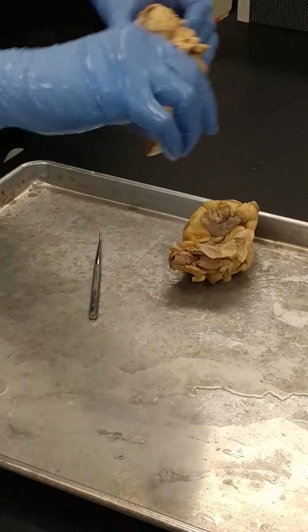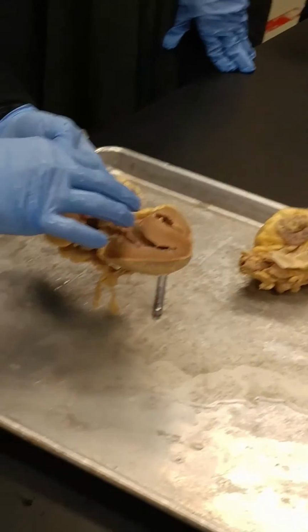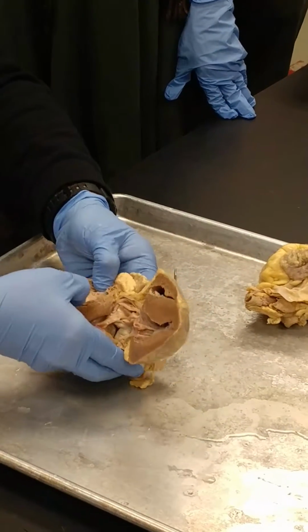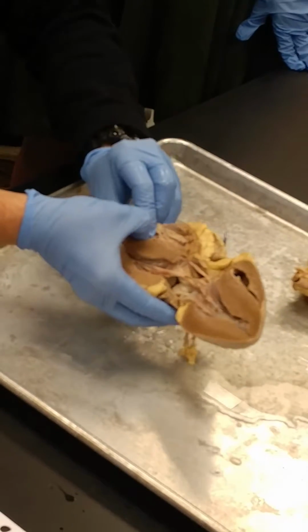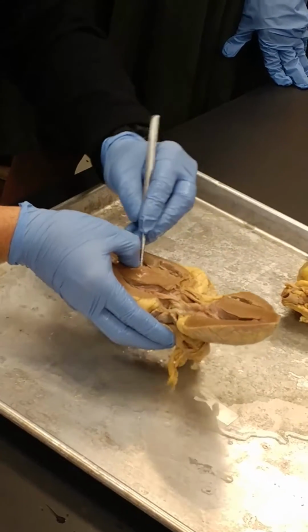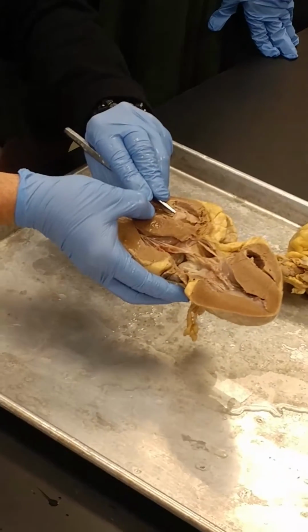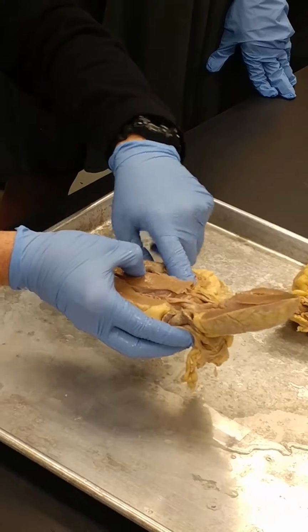All right, so we got the tricuspid valve next. So the tricuspid, remember, was located on the right-hand side, between the atria and the ventricles. So the tricuspid valve is this dude, right? So this is the right side, thin wall, okay? This is one of the tricuspid valve cusps right here. You can see it. I'm lifting it up. See it right there? So this is going to be right ventricle. Up in here is going to be right atrium.